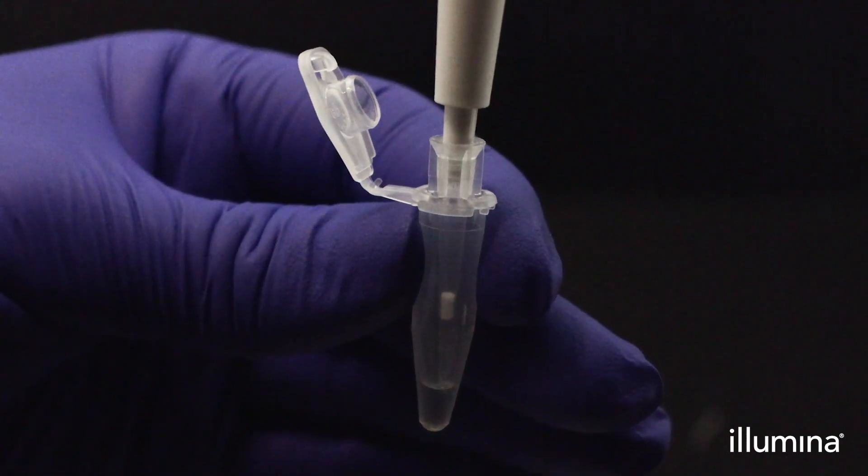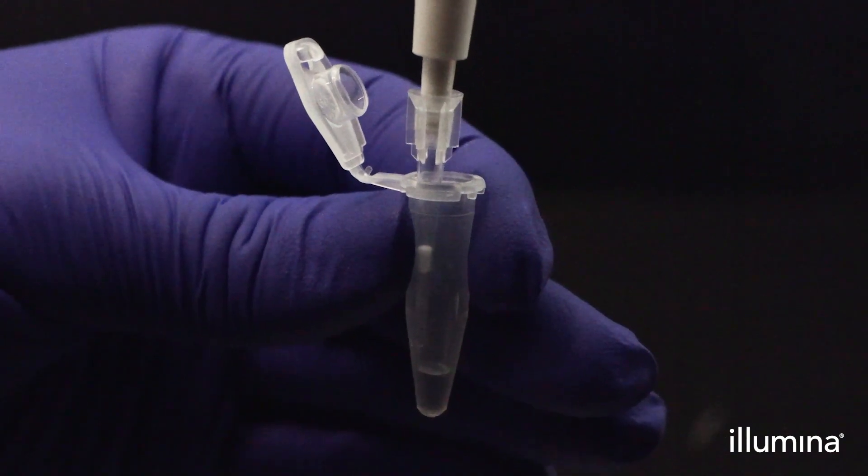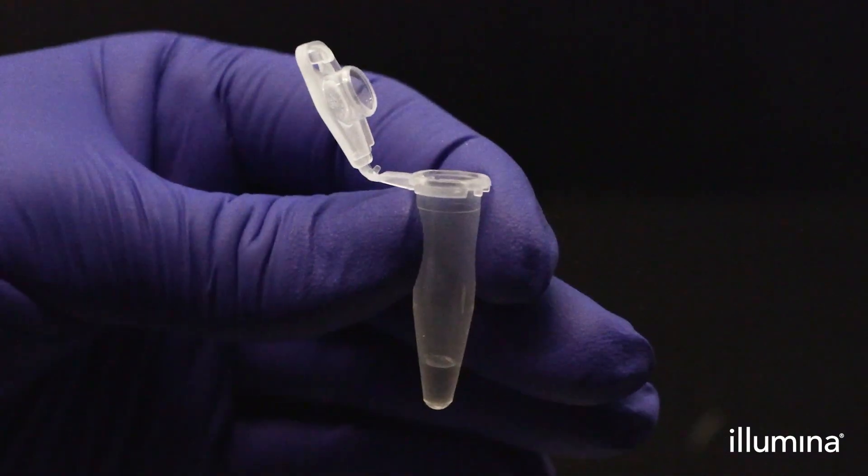If performing multiple reactions, add cells and RNase inhibitor to all pip tubes before proceeding to the next step.